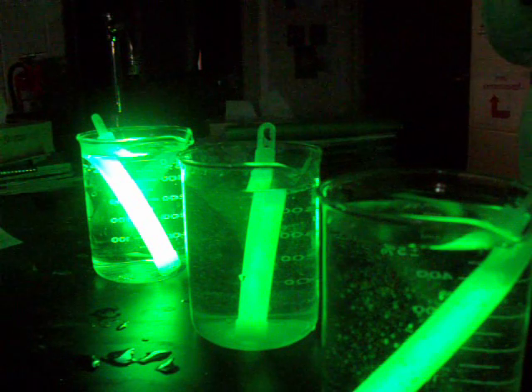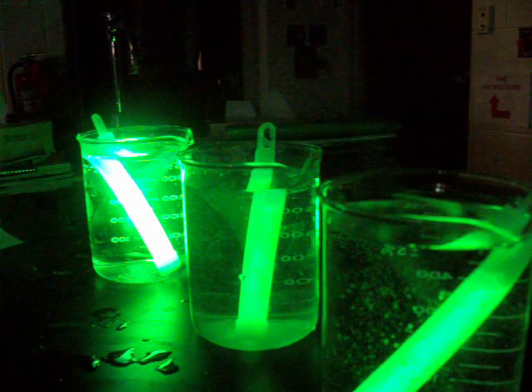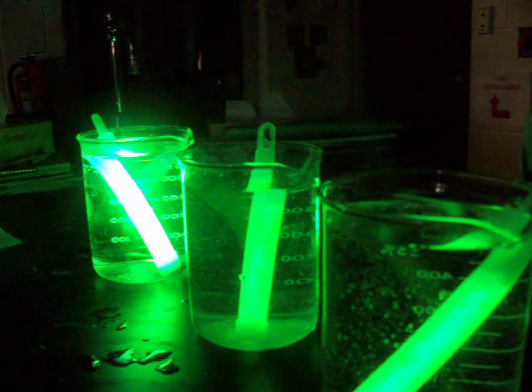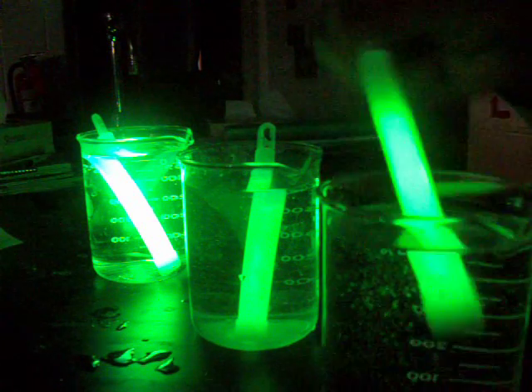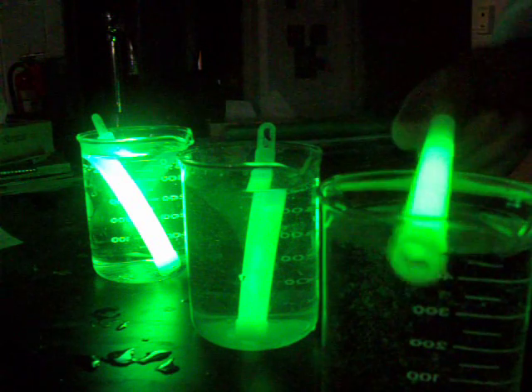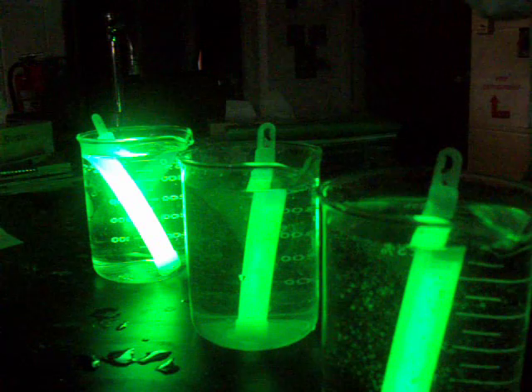And when they vibrate faster, they have more energy, and more energy results in more light being given off. Simple. Reverse process is happening down in the cold beaker. What happens in the cold beaker? When we cool it down, what do they do? They slow down.